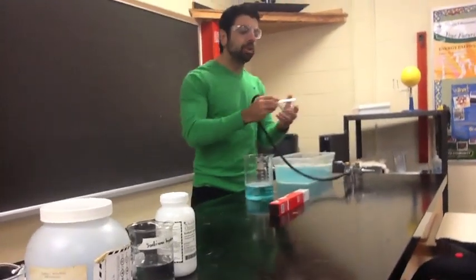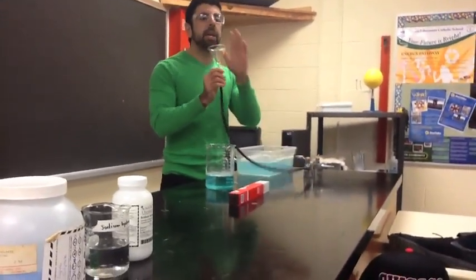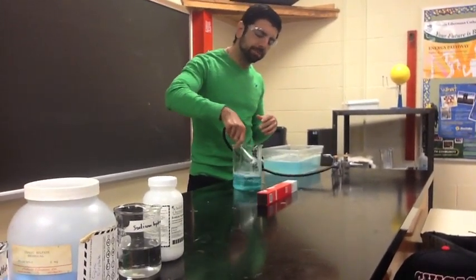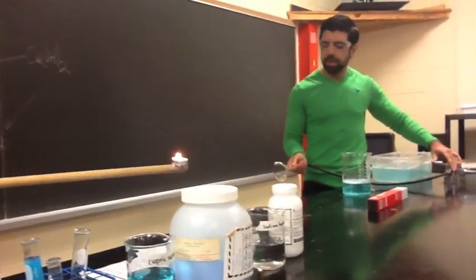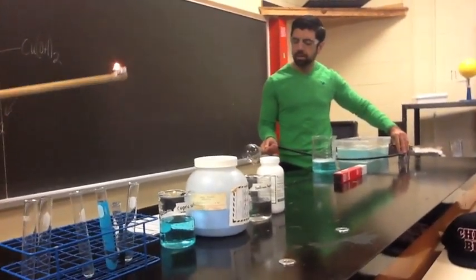So what I'm going to do is, with the glass tubing — the tubing, I've already checked it — I've got the glass funnel. And what I'm going to do is I'm going to get a bubble. Whoa. That's beautiful. And I'm going to fill it up with methane gas. Whoa. This is so messy. So cool.